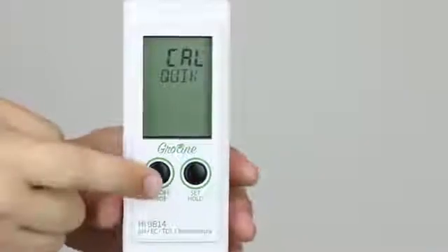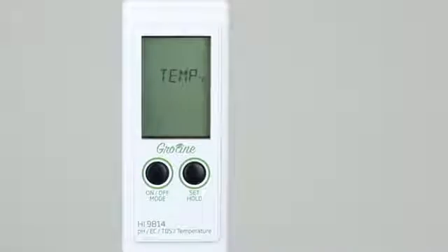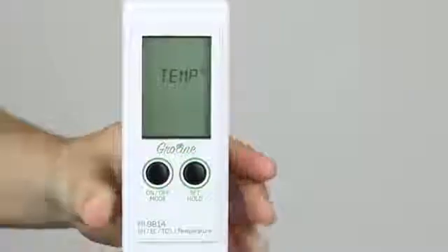Press mode to select temperature units. Pressing the set button changes from Fahrenheit to Celsius.